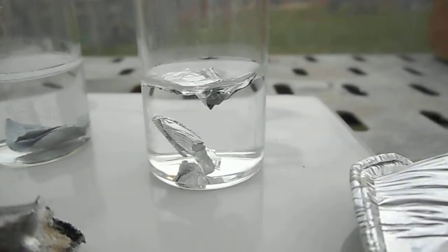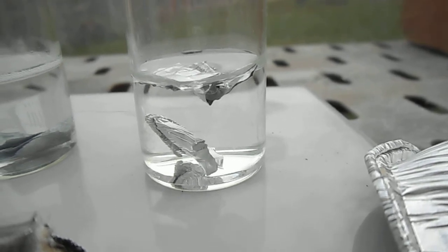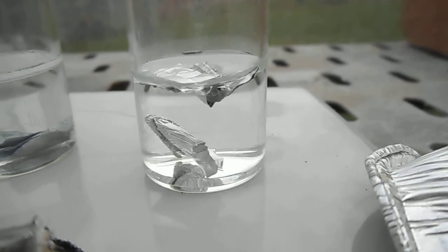And finally the aluminum. Well, here again, not much evidence of a reaction occurring yet for the aluminum.